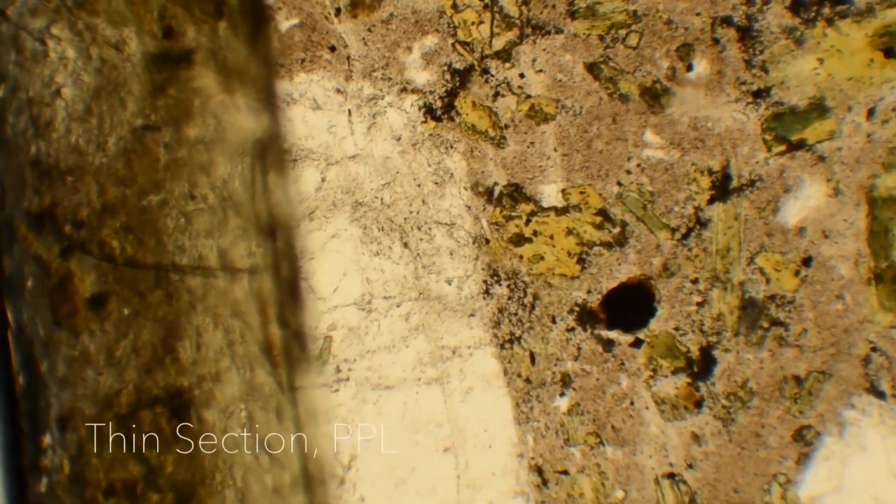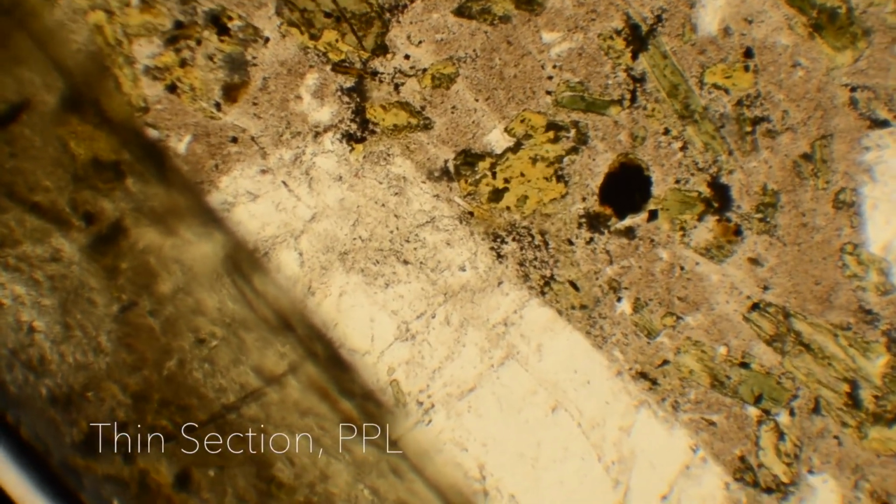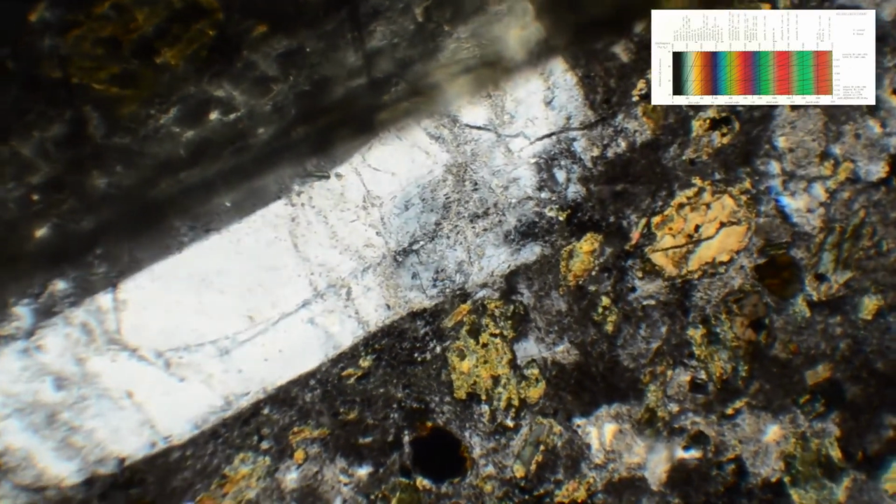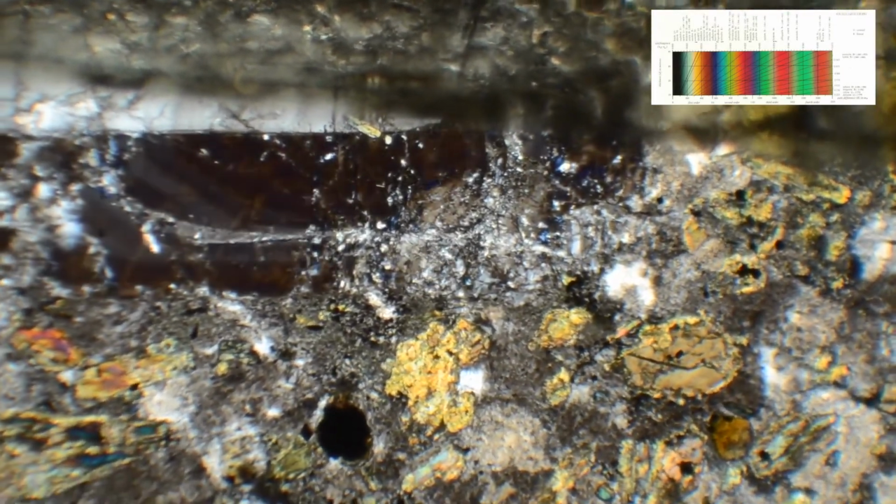Let's try an example of a mineral grain in a thin section. First, we start out in plain polarized light. Let's perform this exercise on the large white mineral in the center of the field of view. Here, we insert our analyzers and observe the interference colors in cross-polarized light. The striping that you are observing are zones in which the mineral grew, similar to tree rings.